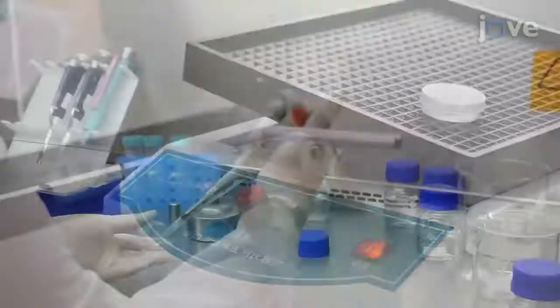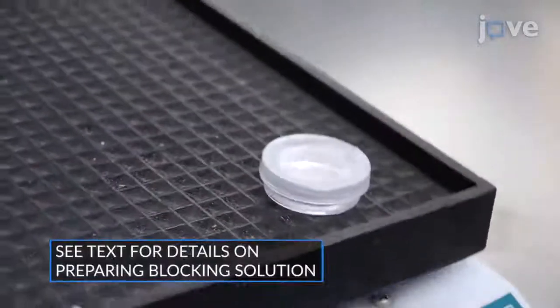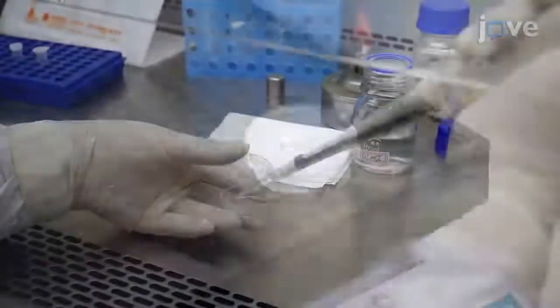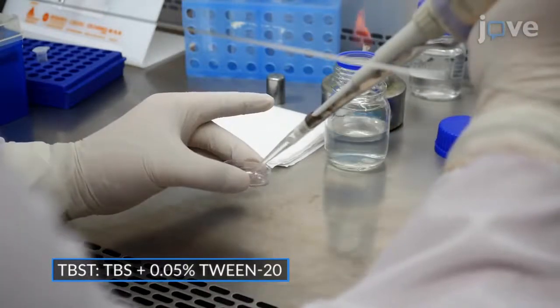The next day, pour off the coating solution and add the prepared blocking solution. Incubate at 4 degrees Celsius for at least 1 hour. Then, discard the blocking solution and quickly wash the plate 6 times with TBST while making sure the dish does not dry out.